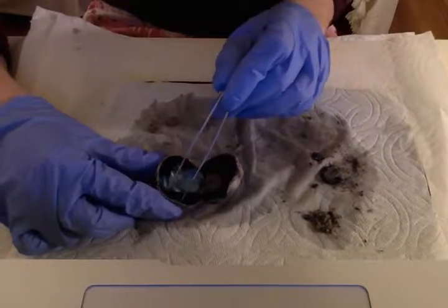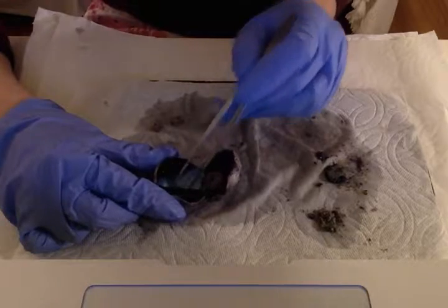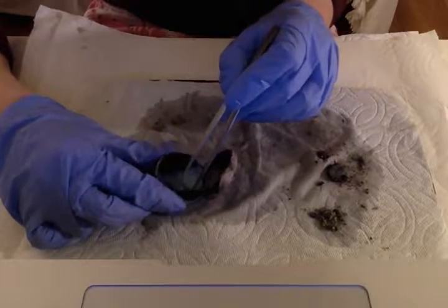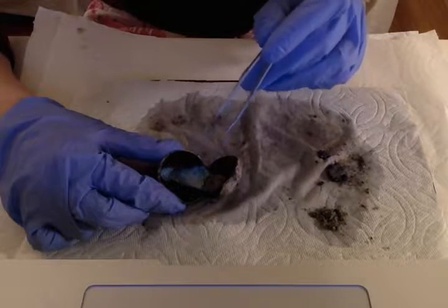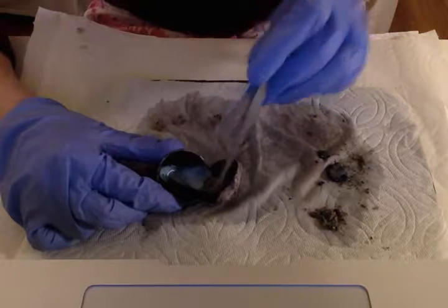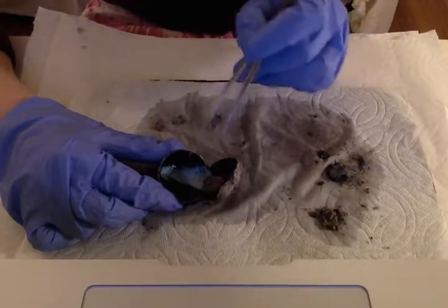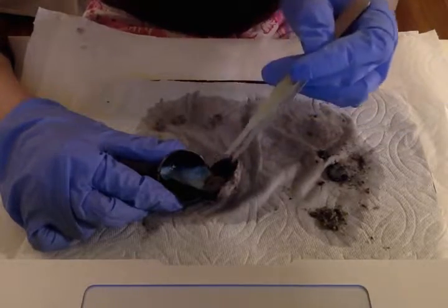It did fall off. But interestingly, the choroid, I hope I'm saying that correctly, is a vascular layer of the eye that's between the retina and the sclera, which remember is the white of the eye. And the choroid is important because it provides oxygen and nourishment to the retina. Now, in some animals, such as the cow, the choroid has an area that doesn't contain melanin, and this area is called the tapetum lucidum, and it's highly reflective, and basically it allows for better night vision by reflecting the light in a very controlled manner.